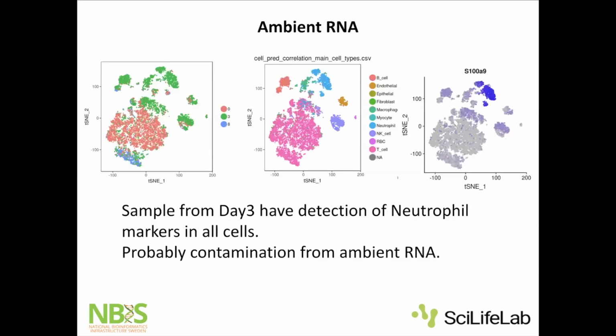And as we talked about, you might get RNA leaking out into the soup, so to say, and if you have RNA in your cell suspension liquid, it will end up in every droplet that you're running. Here is one example from a colleague who worked with data from 3 different time points. As you can see in time point 3, we have neutrophils up here, but also all other cell types that are not neutrophils seem to have low expression of several neutrophil markers. So it looks like we have leakage and broken neutrophils at that time point. And then, of course, if we go in and want to do differential expression of T cells from time point 3 versus time point 0, it will look like T cells at time point 3 have neutrophil genes turned on. So you need to be really cautious and at least look at whether you have ambient background RNA.